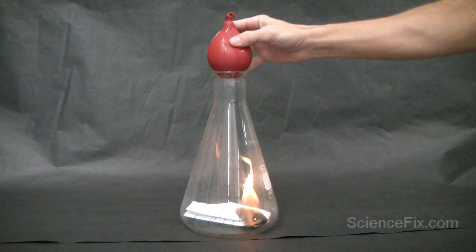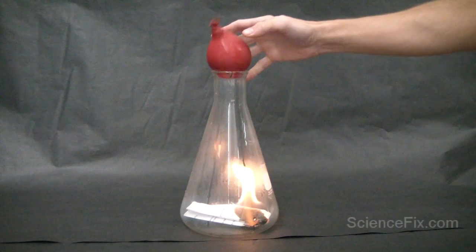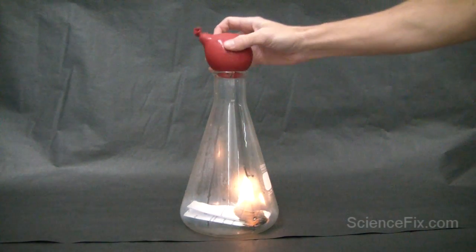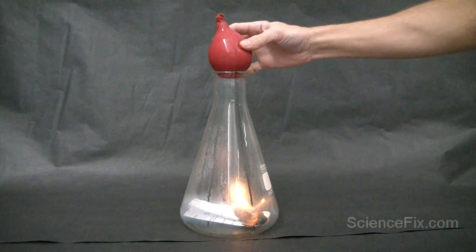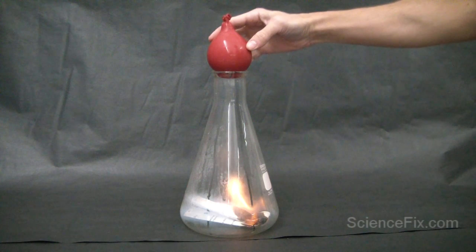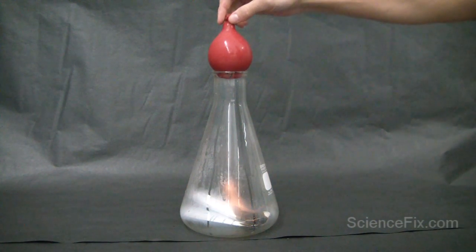During the chemical reaction, gases are produced and heated up and they try to exit the container, the flask. You can see that the balloon is being pushed around because those hot gases are exiting.